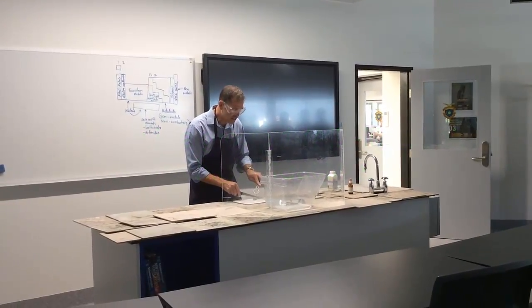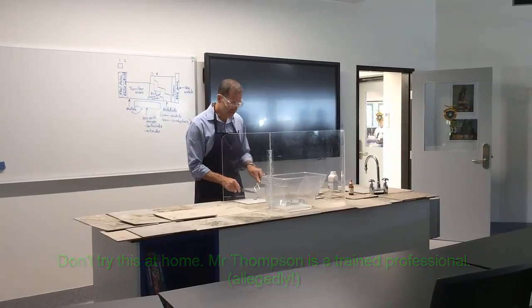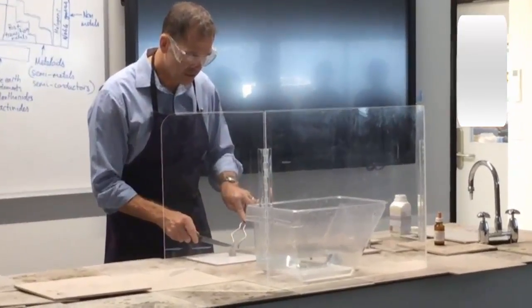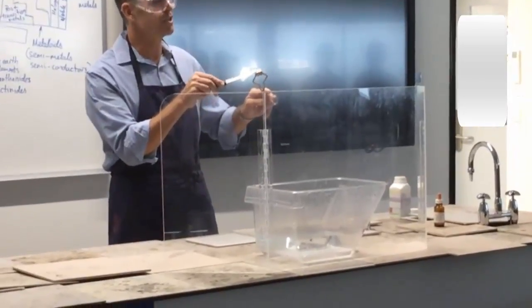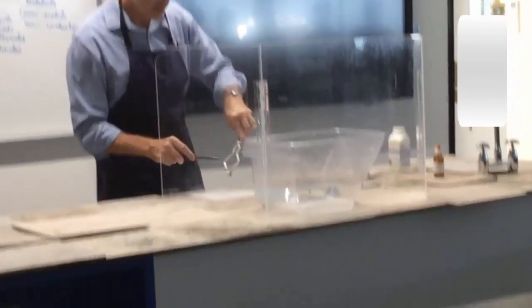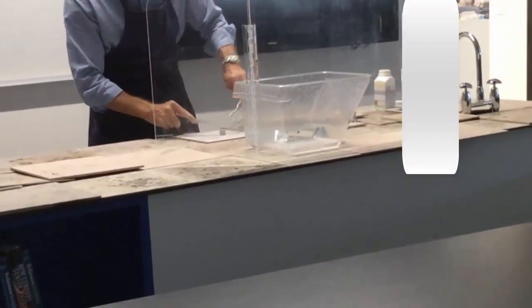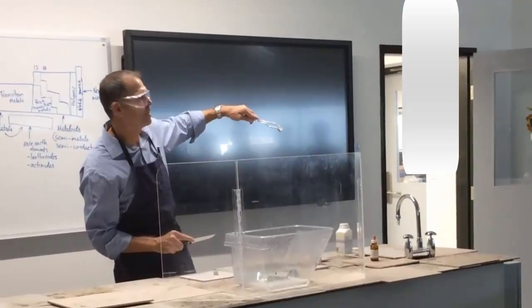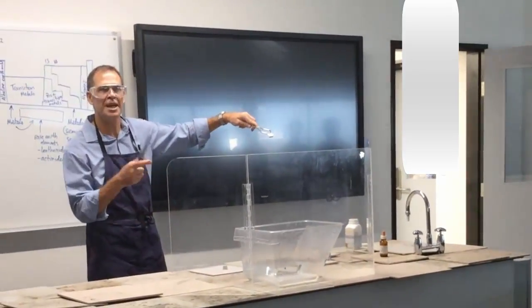So you can see, I can actually cut this — it's not as soft as butter, it's a bit firmer than that, but it's actually quite soft. You might be able to see on the outside that it doesn't look very shiny, but when I actually chop it up, if I cut a slice here — you see that? I don't know if you can see that, but now it's very shiny on the inside, because it hasn't had a chance yet to react with the air.